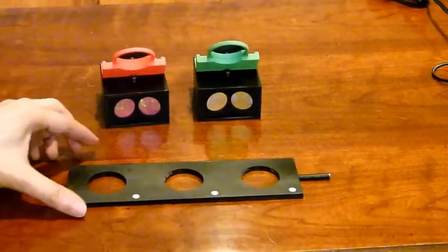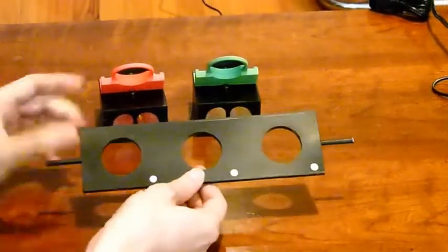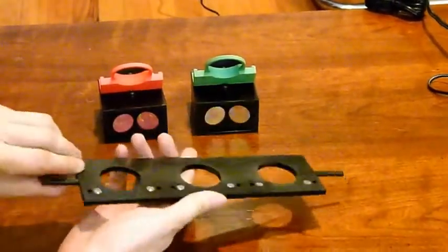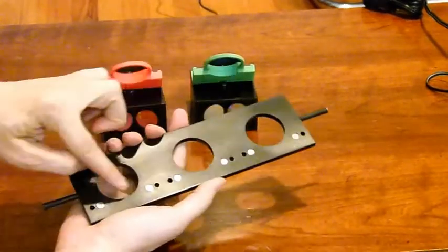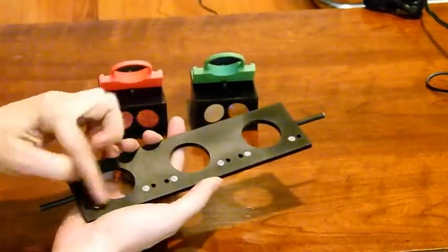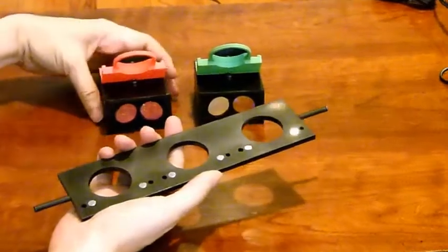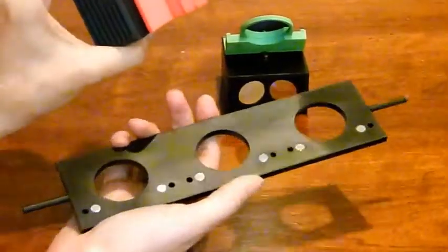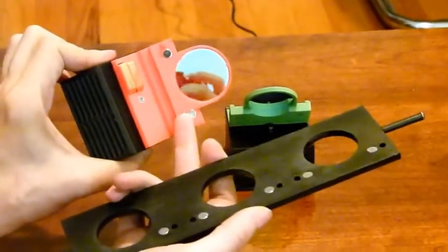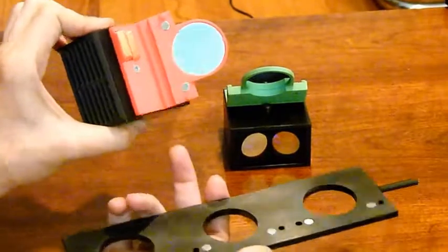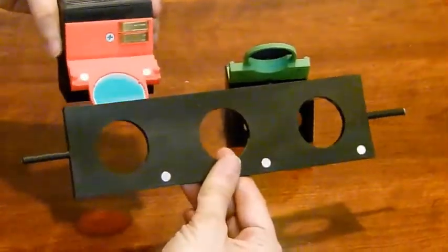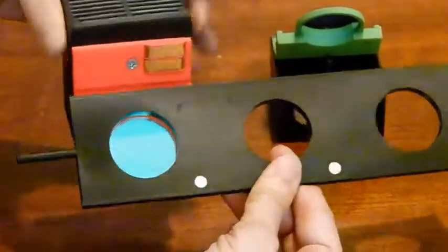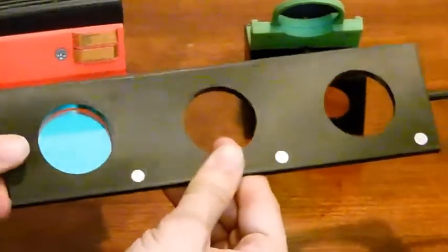Okay, so first I'm going to show you how to put these modules onto the slider. It's super easy to do because they have guide pins and magnets to attach them. So on each lamp you'll see there's guide pins and magnets. All you do is you get it underneath the slider and it snaps right into place.